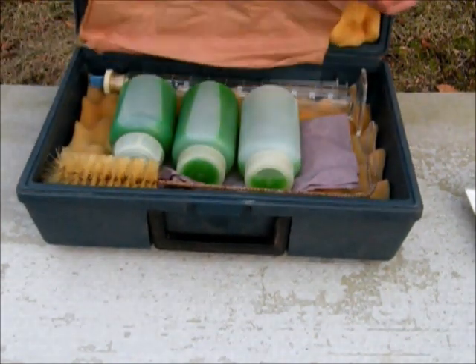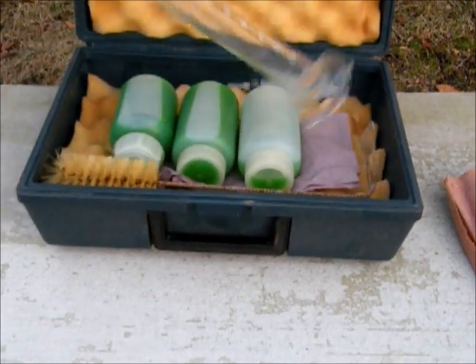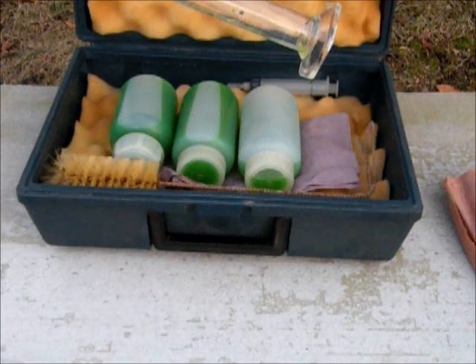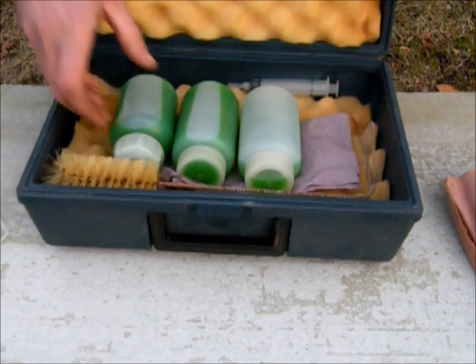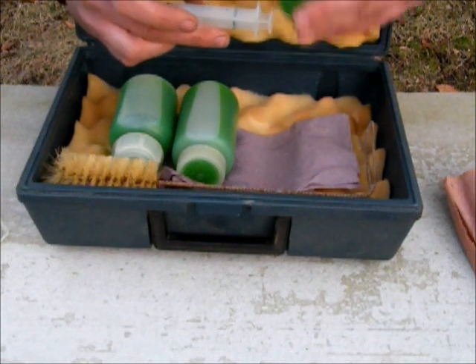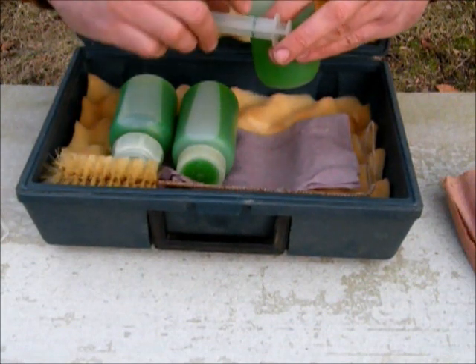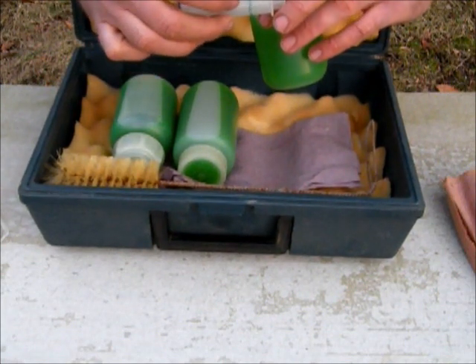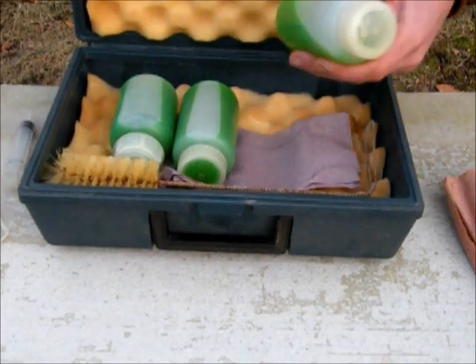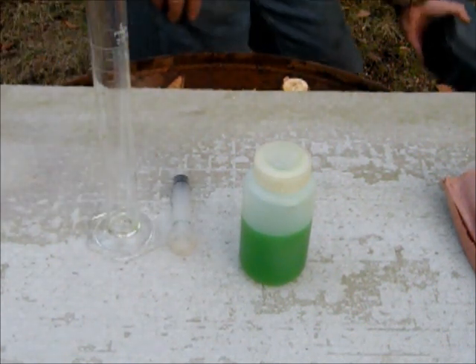This right here is it. It doesn't really consist of a whole lot — just a brush for cleaning the test tube out. It's got this tube that's graduated in milliliters up to 100 with a stopper in the top, and then it's got ethylene glycol and a syringe that goes to 10 milliliters. Apparently the markings wore off a long time ago, so Dad put a mark around it where the 10 milliliter mark used to be. Three things, plus the gasoline to be tested.